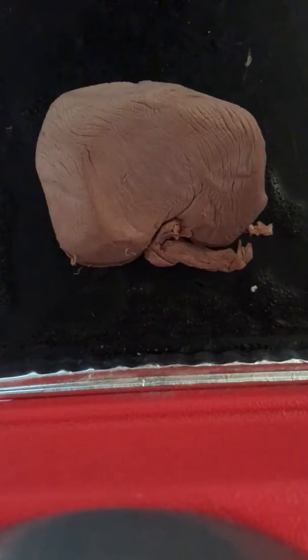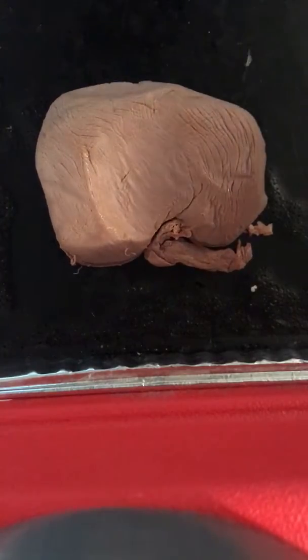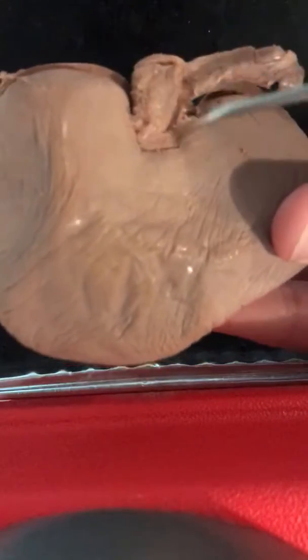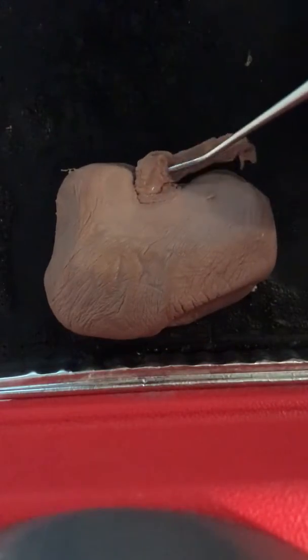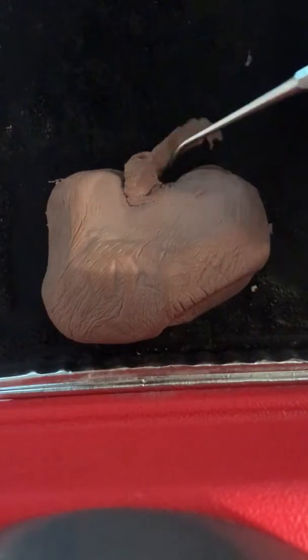So this is the kidney sheep dissection, and first we'll go over the outer surfaces. The renal capsule is the surface that covers the kidney, and then we have the renal hilum, which consists of the veins, and it's the concave surface that's right here. Then we have the renal artery, which is here, and then the renal vein, and then here's the ureter coming down.